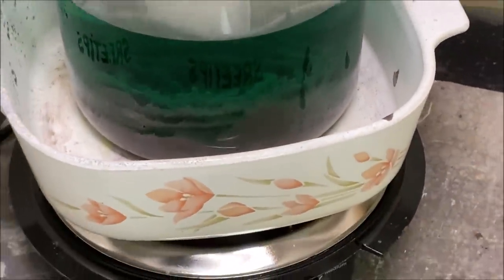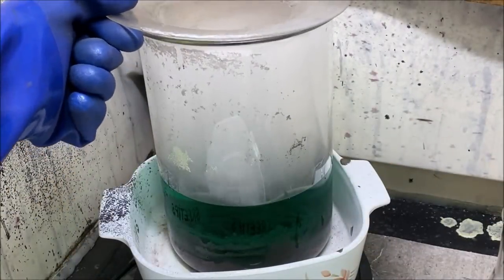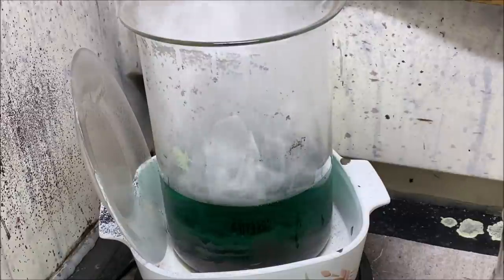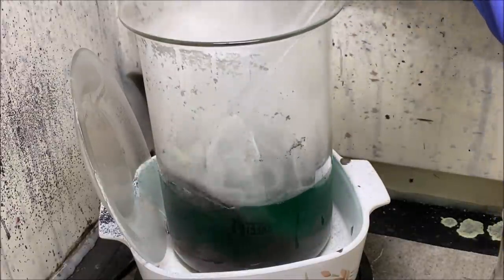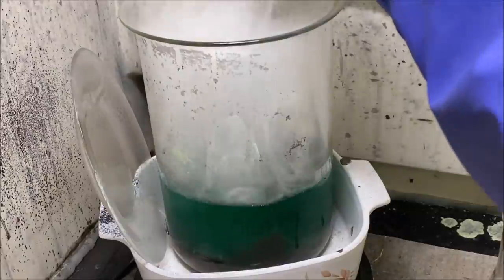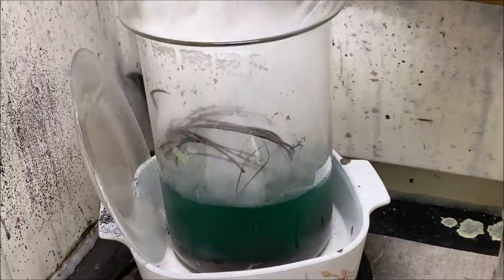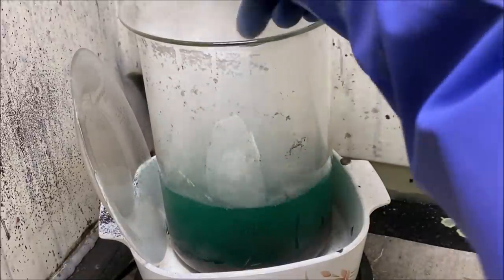Getting down in there with a glass rod to check this out. I've got my long gloves on up to my elbows. This stuff scares me. The wire is corroding away slowly but surely. I don't know what that residue is down in the bottom of the beaker — it might be silver. The wire is being dissolved by the acid, and once we get everything dissolved we'll move to the next step.